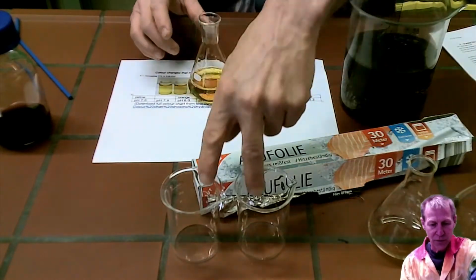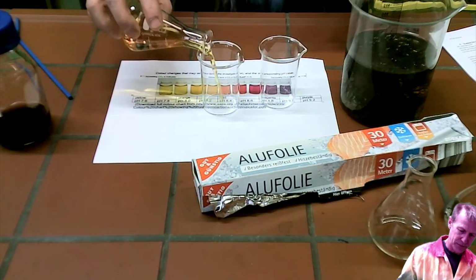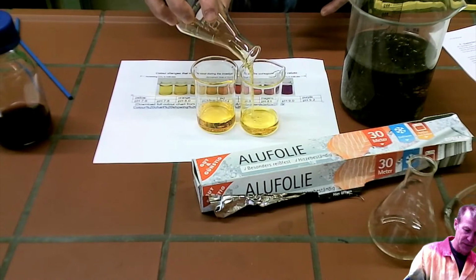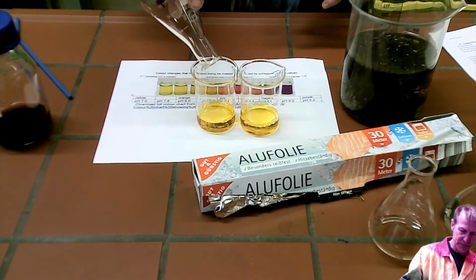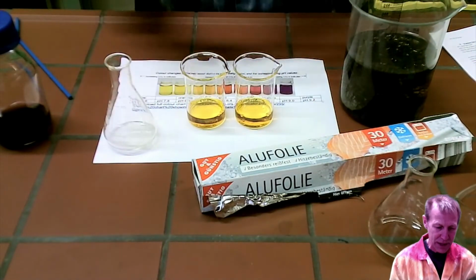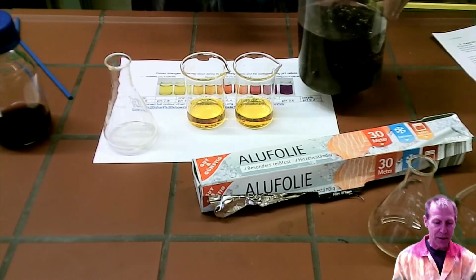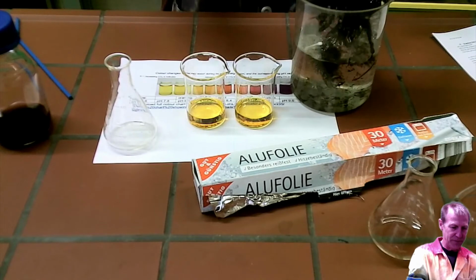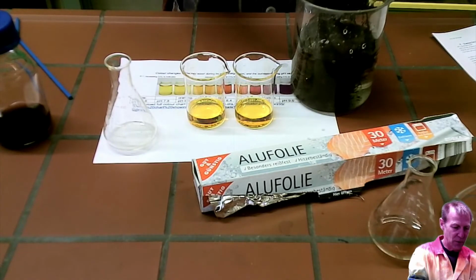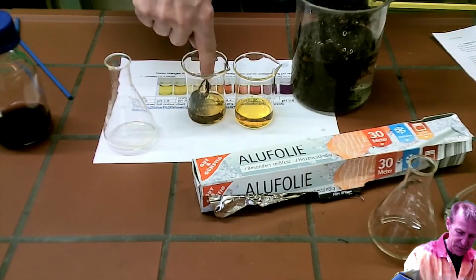Okay, so now what I will do, I might not have enough of this solution, we'll see. So I'm going to pour equal halves of this. This is part 2, I guess you could say. So part 1 was just setting up the solution, adding the carbon dioxide. So this was me exhaling carbon dioxide through the process of cellular respiration. Okay, I'm now going to add some of this aquatic plant to each of them. And at this point, you might predict what the outcome of this will be. So I will put a sprig of this plant into each of these.